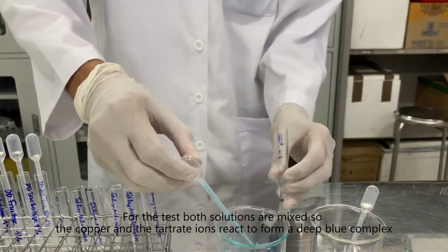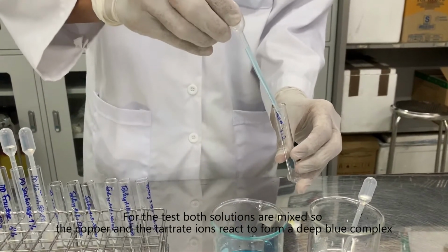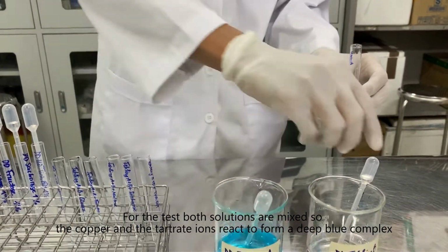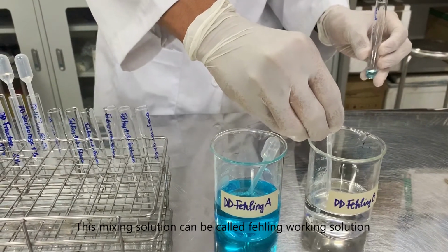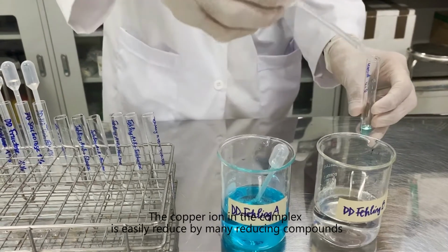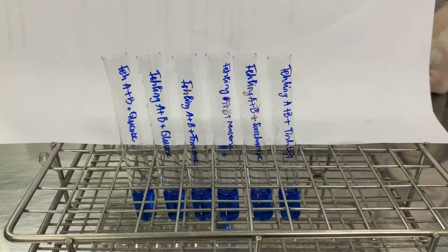For the test, both solutions Fehling A and B are mixed so the copper and the tartrate ions react to form a deep blue complex. The volumetric mixing ratio is 1:1. This mixed solution is called Fehling's working solution. The copper ion in the complex is easily reduced by many reducing compounds.